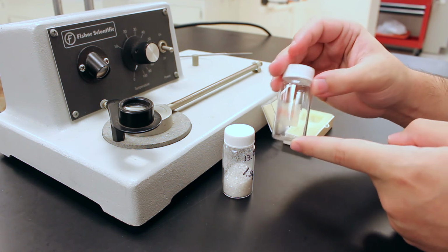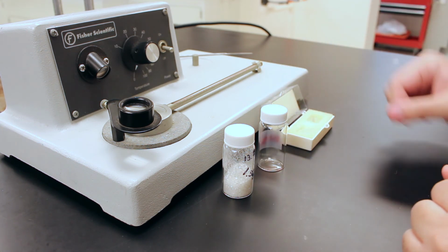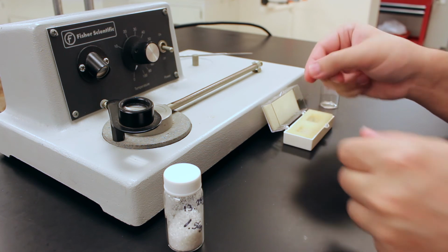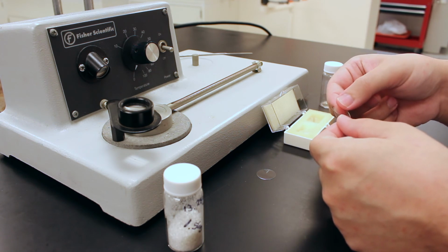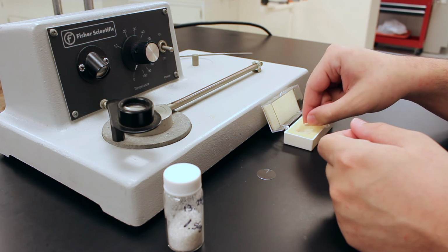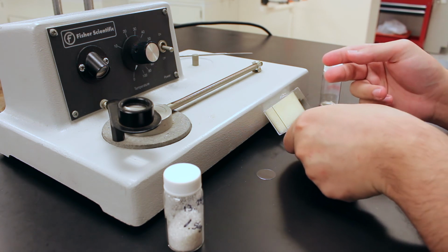So this is our pure product, and if you'll remember earlier in the experiment, we took a small sample of some of the solid from the reaction before crystallization, and this is what we're going to use to prepare the melting point samples. So a melting point sample is prepared by sandwiching a little bit of the solid in between these little cover slides. And they're little glass lightweight slides, and you don't need much solid, just a little bit. And they're very difficult to separate.